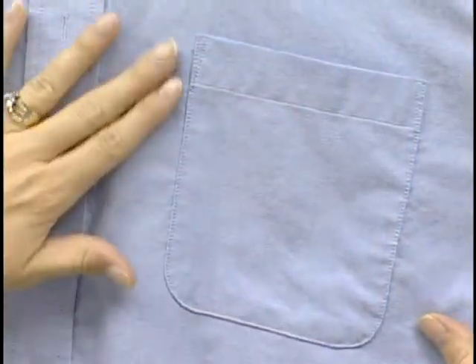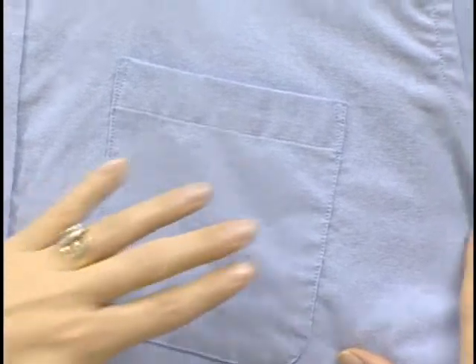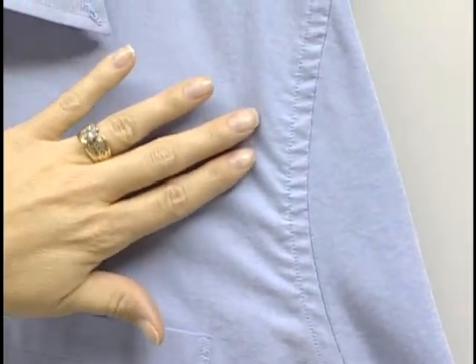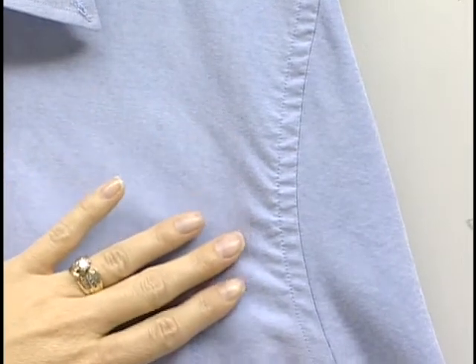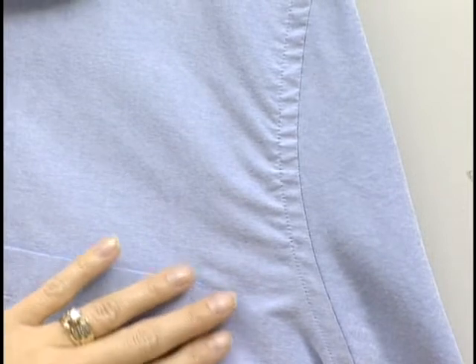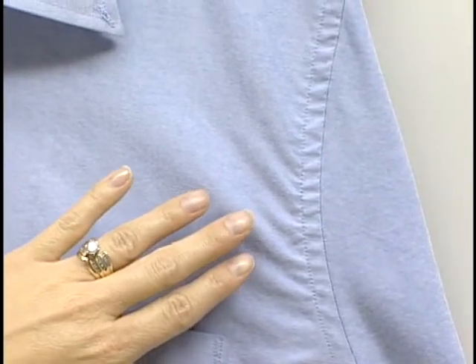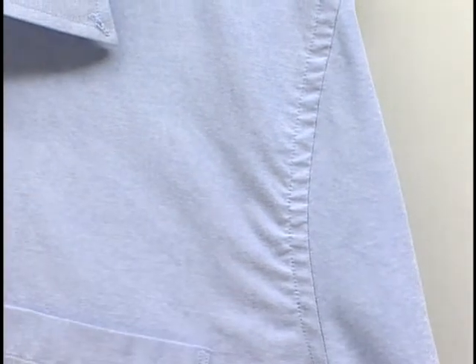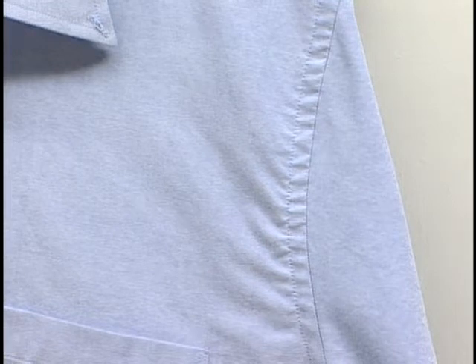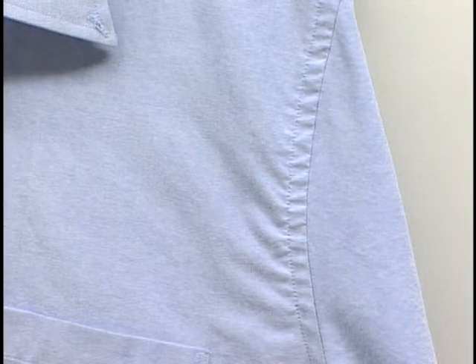This test method is designed for evaluating the smoothness appearance of apparel and other textile end-use products. Non-apparel products would include sheets, blankets, and other various home products. Within these products, fabric areas, seams, and the retention of pressed-in creases are evaluated for durability and appearance. Any washable textile end product made from woven, knit, or non-woven fabric may be evaluated for smoothness appearance, seam smoothness, and crease retention using this method.